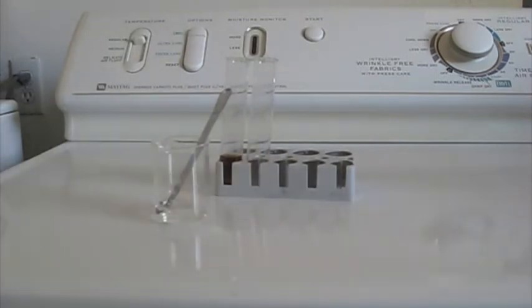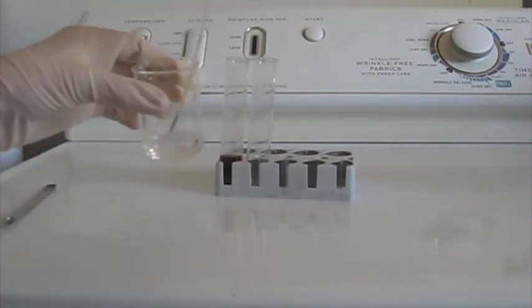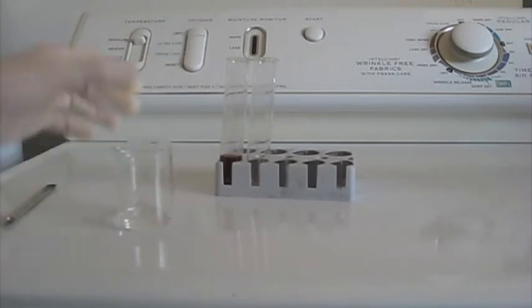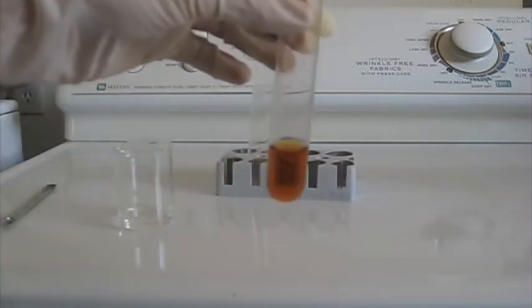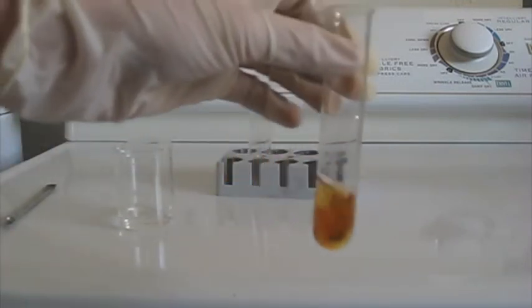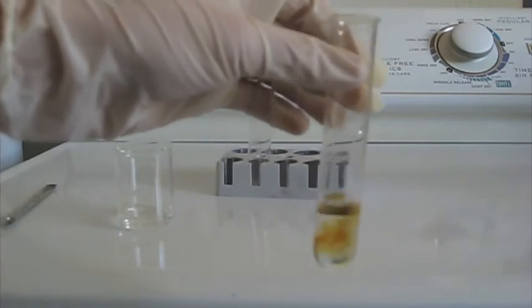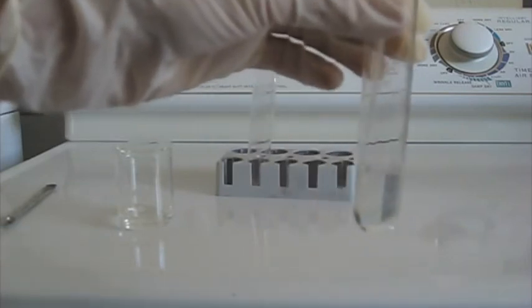This is sped up. Takes a little while for me to get all my stuff ready. So there's my sodium thiosulfate solution, and I take a small amount by pipette, add just enough to make the solution of iodine water and alcohol become clear. You don't want to use too much.